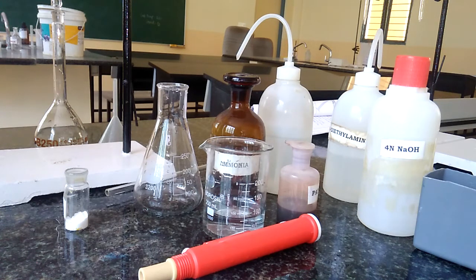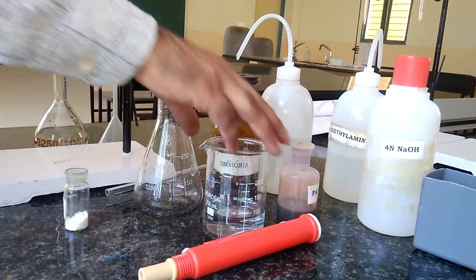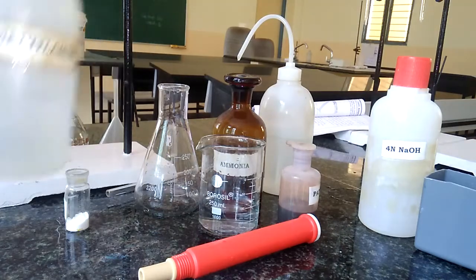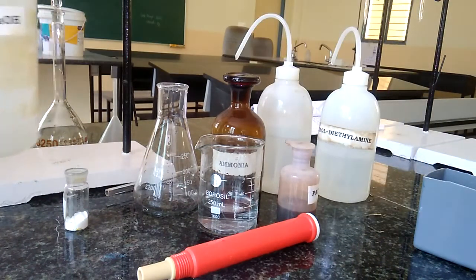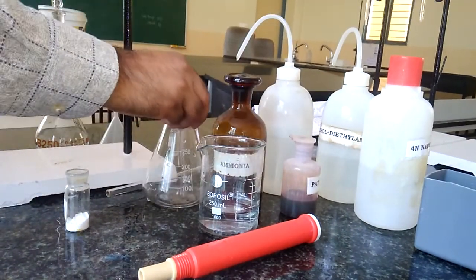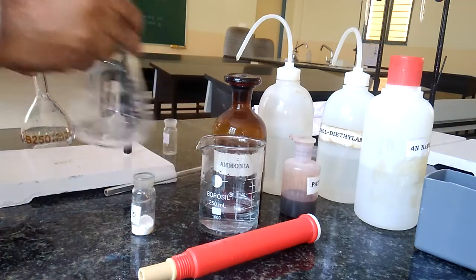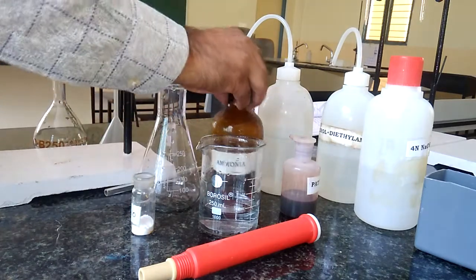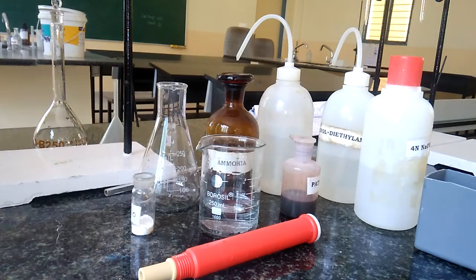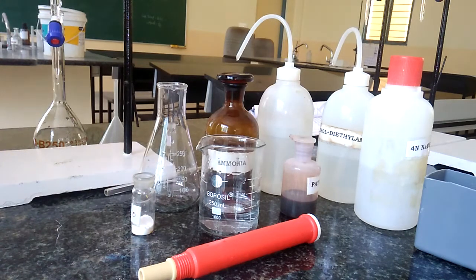For this experiment we need some chemicals and glassware. First, this is the cement solution we require — 25 ml cement solution. This is the diethylamine and glycerol. This is 4-normal sodium hydroxide. This is the indicator called patton reeder indicator. This is the conical flask. The EDTA salt. A 250 ml standard flask. A 250 ml conical flask. Ammonia is needed. And a 25 ml burette.